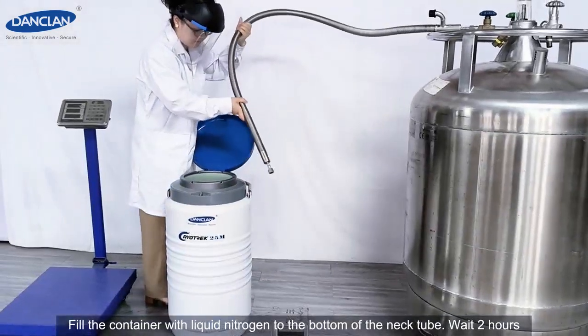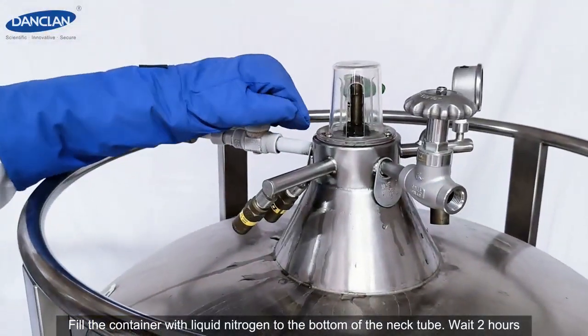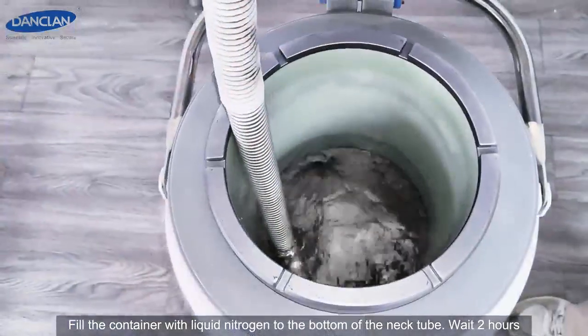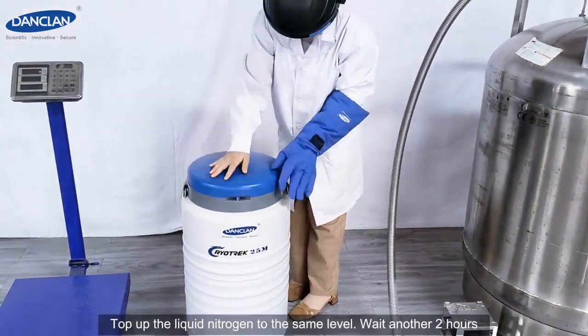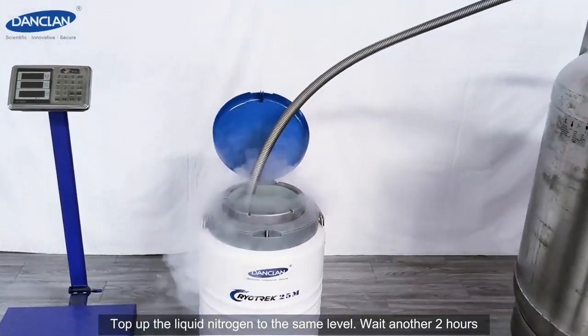Fill the container with liquid nitrogen to the bottom of the neck tube. Wait 2 hours. Top up the liquid nitrogen to the same level. Wait another 2 hours.